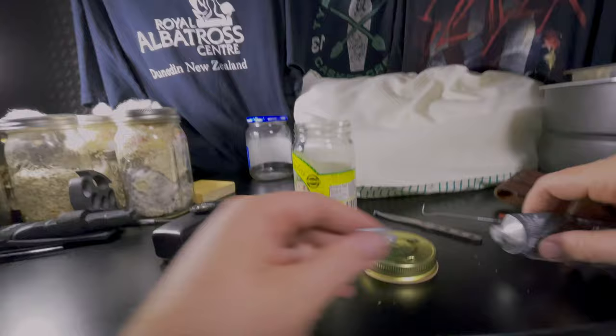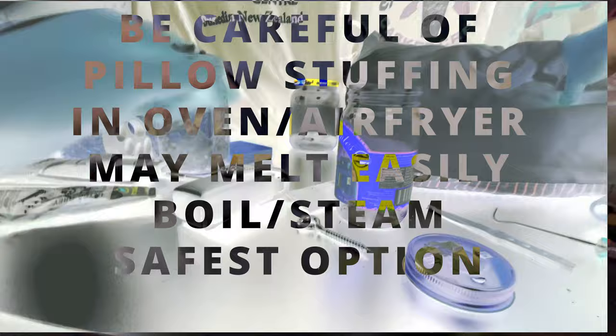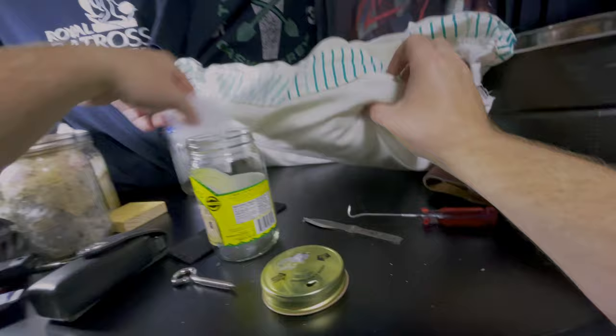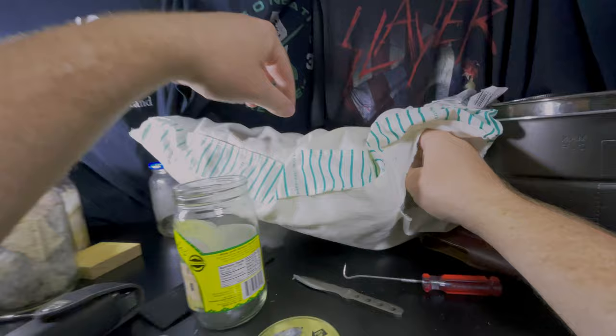If you want to, while you're waiting for it to dry, you can grab some pillow stuffing. I want to get this pillow out of my way since I'm doing this kind of a single shot. I don't want to mislead you about how long it takes or anything. We're just going to pull out some pillow stuffing. Not all pillows are going to be the same. I had to check. I mean, this was the first one I tried.